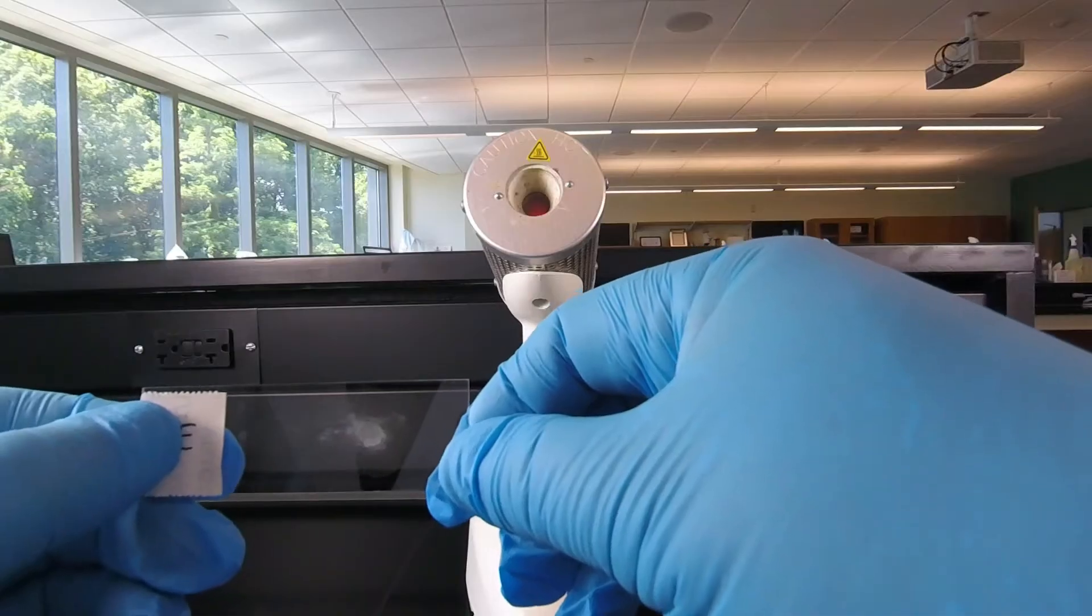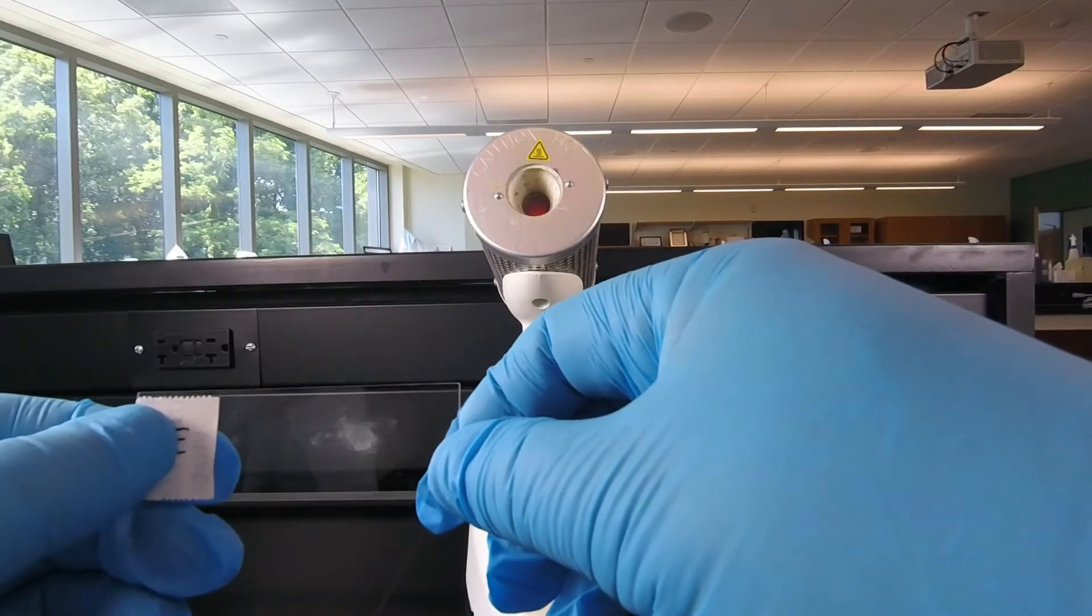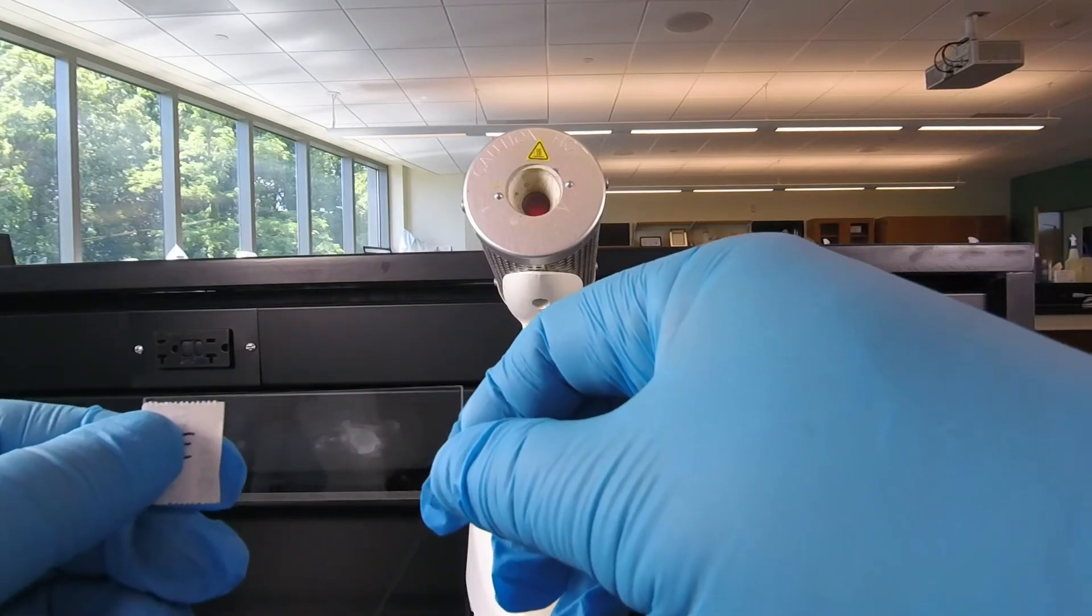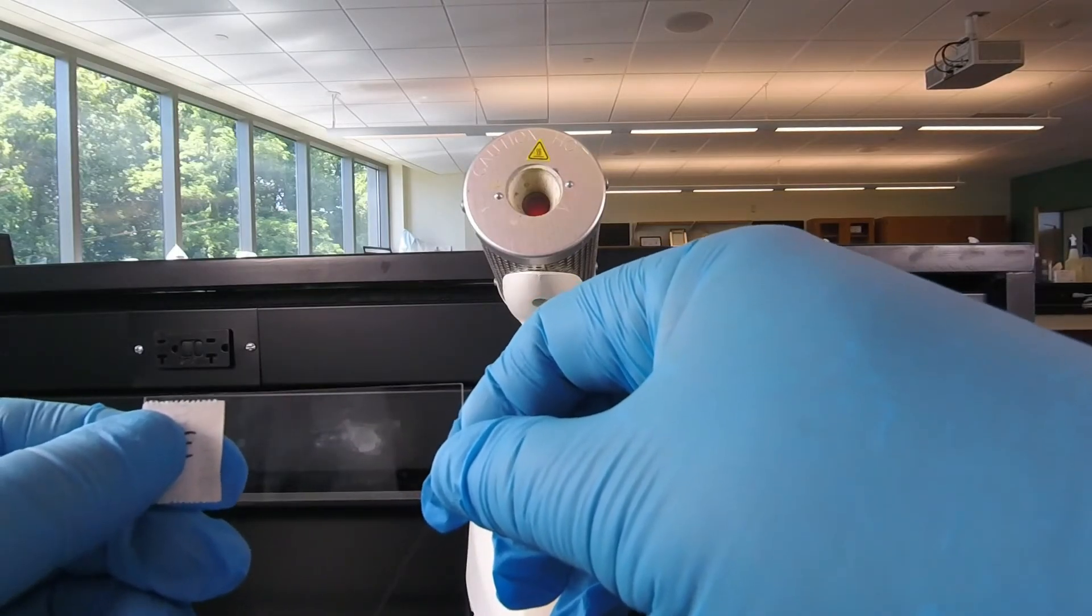If it looks like this, it's probably a pretty good smear. If you can't see through it and it's so thick, there's probably too many bacteria. If you don't see anything, there's probably not enough. You may have to repeat the process of preparing the smear.